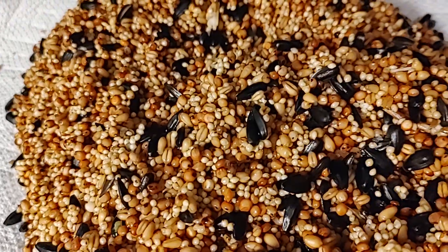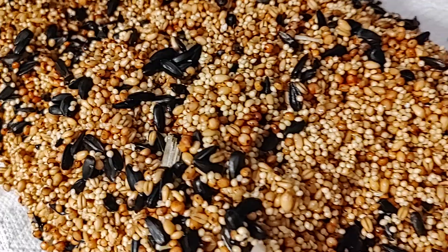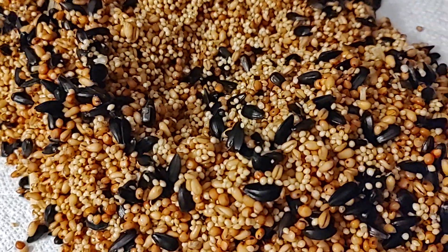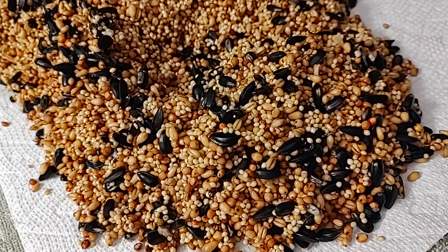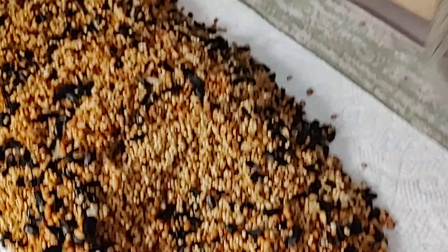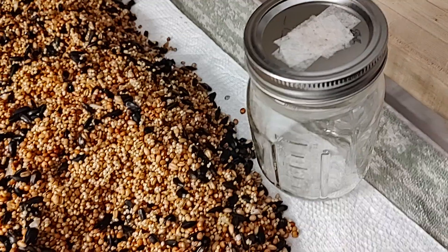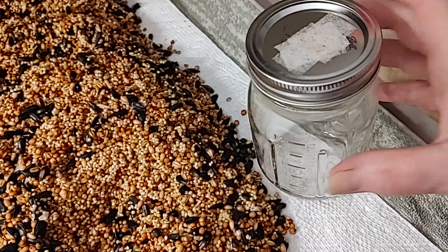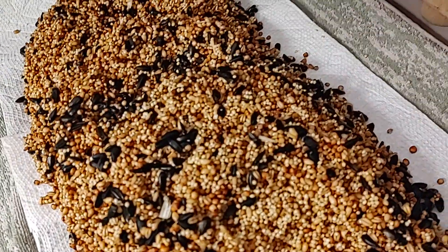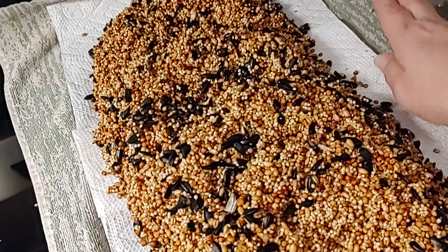We're going to get it into the jars and then pressure cook. It's actually nighttime here, so we'll pressure cook for an hour and a half, let them cool overnight, and then we're going to be putting both slurry and LC with a syringe right in here. We'll be growing two different types of mushrooms, and with the modified lids you'll need to use foil on top.